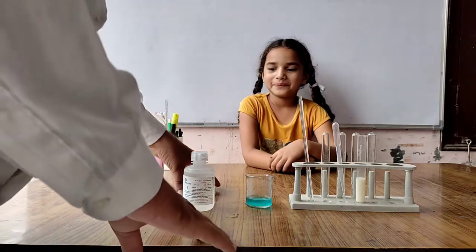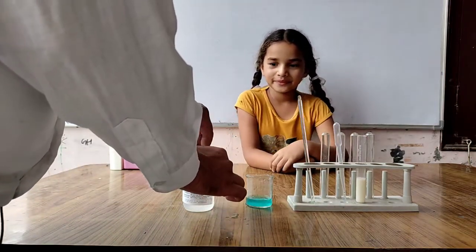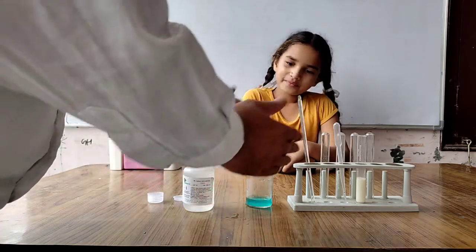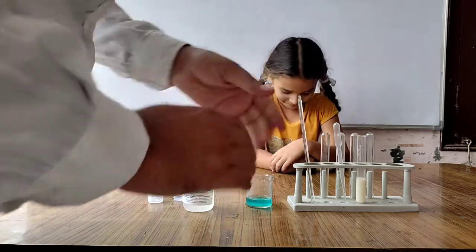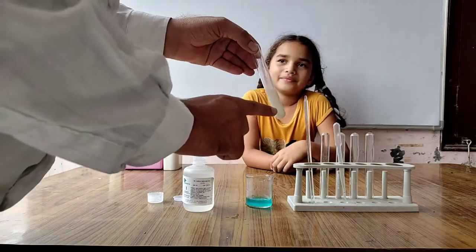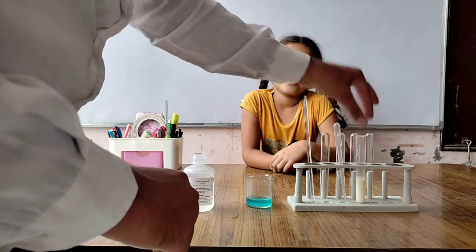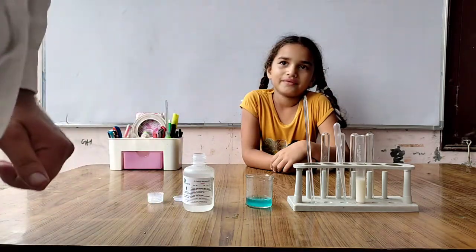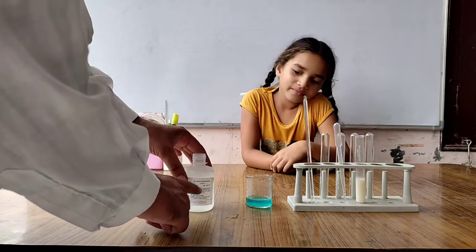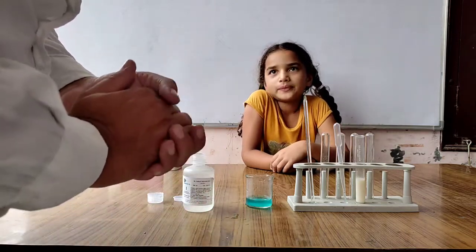Now students, we are performing the experiment to check the protein present in the food material. For this, I am taking milk in a test tube along with copper sulfate and caustic soda, which is dilute sodium hydroxide solution.